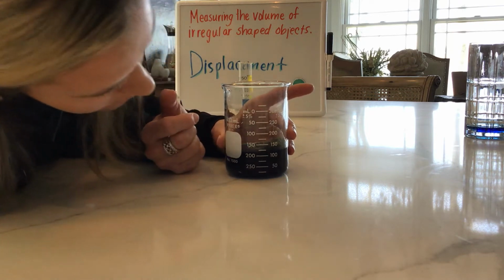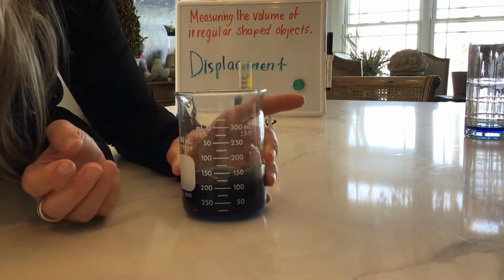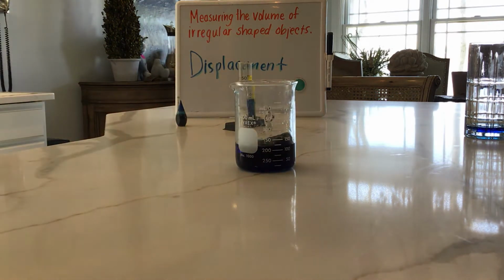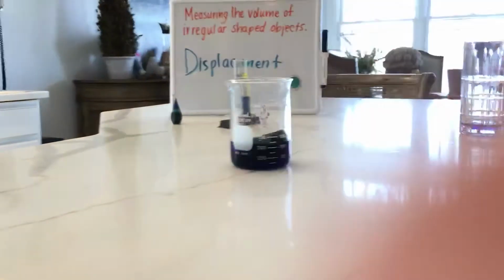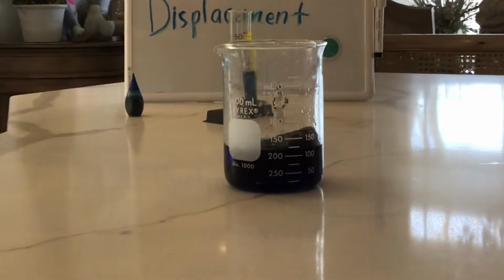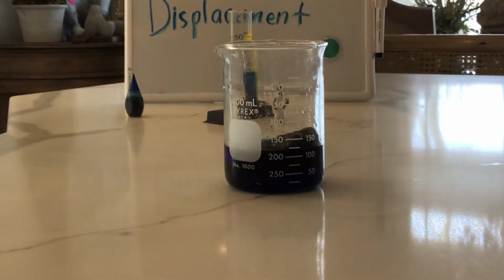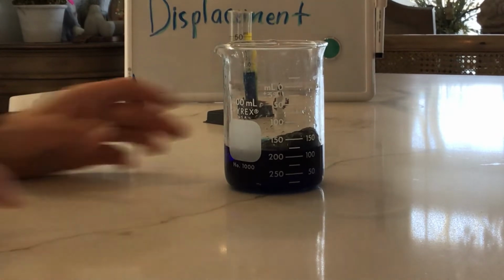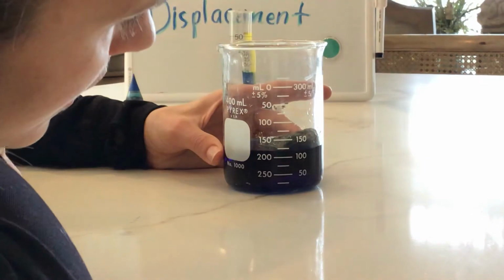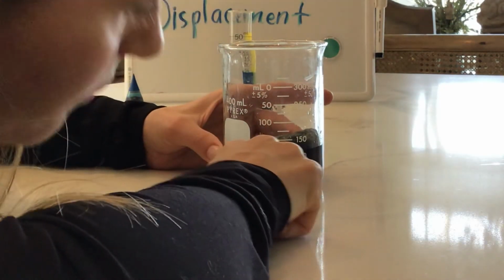Now, if I look at my measurement, see if I can zoom in for you. You see it? Well, now my water level is a little less than 125.